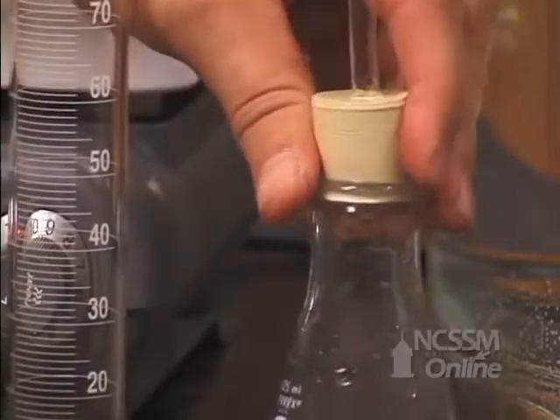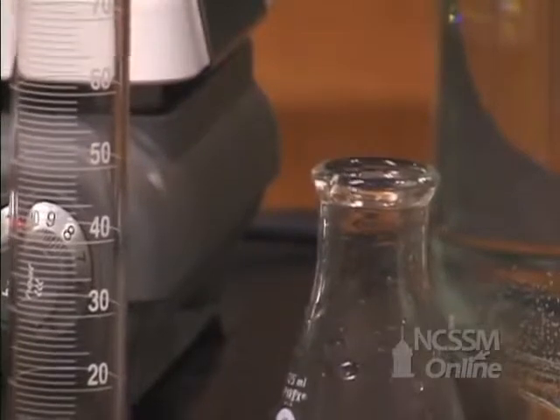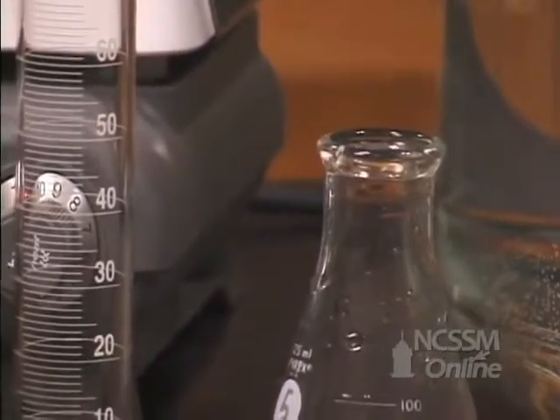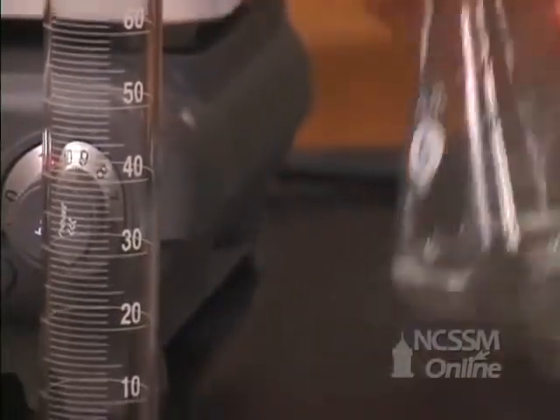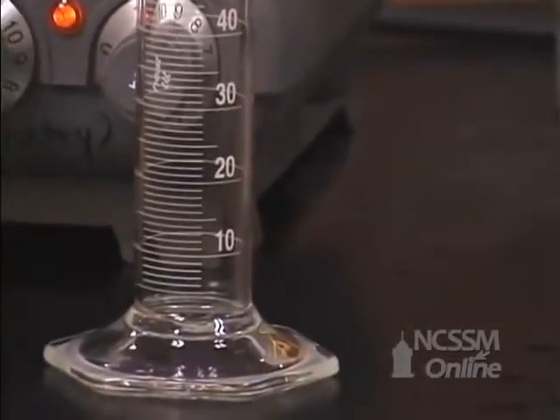We will carefully remove the rubber stopper from the flask and pour the water into a graduated cylinder.